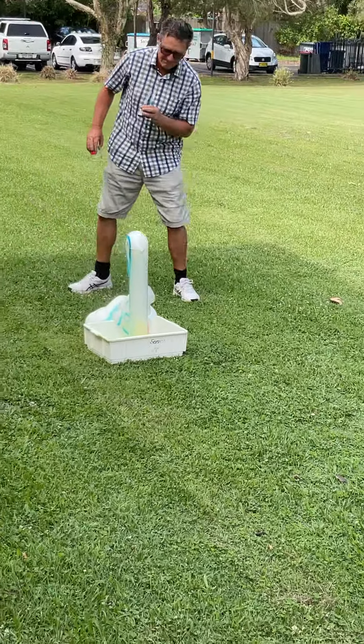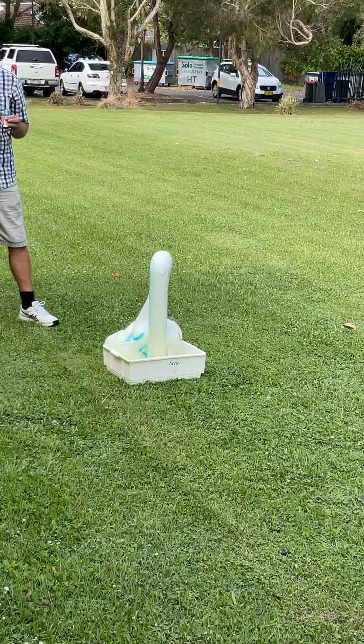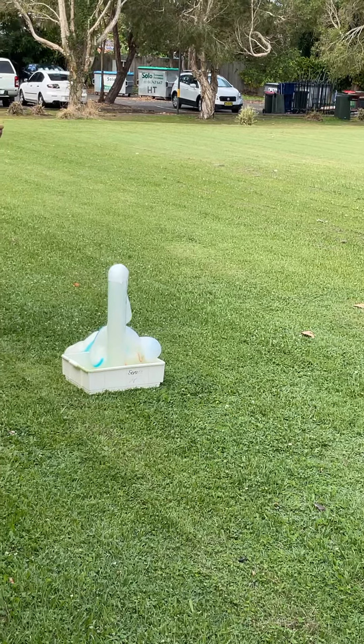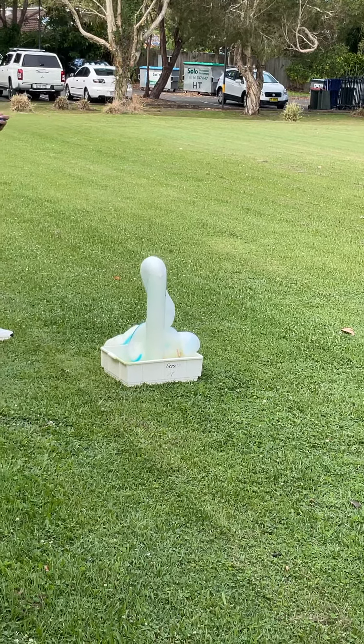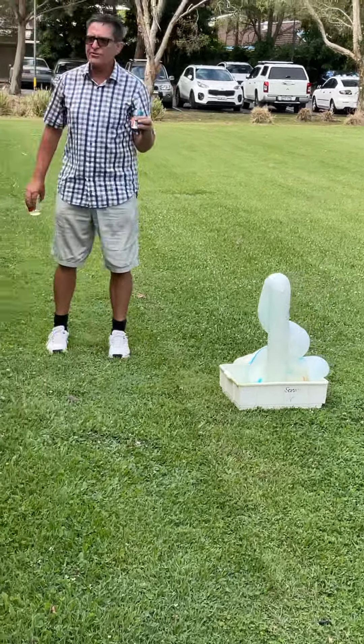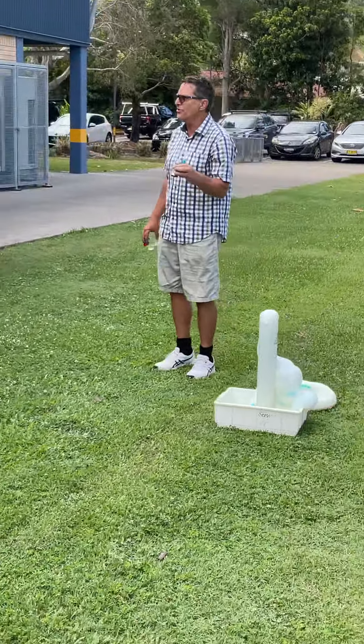Is that striping? There we have striped elephant toothpaste! Don't touch it because it's hot, and there might be some hydrogen peroxide in there. It's not reactive, but as I said, hydrogen peroxide — H2O2 — is toxic.